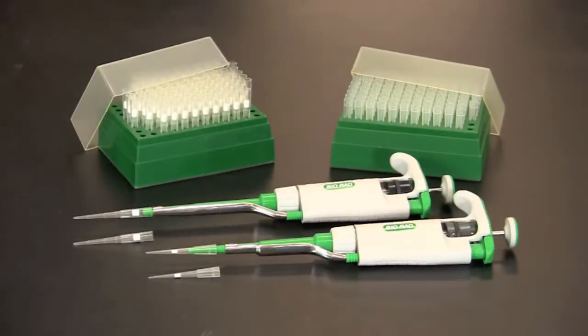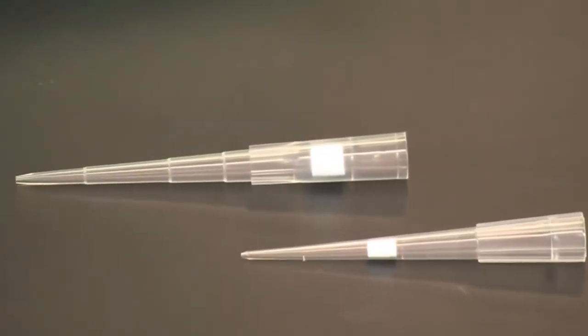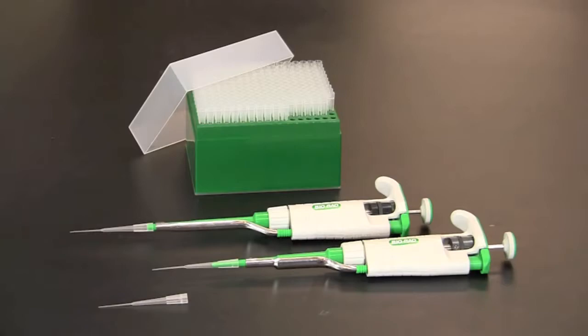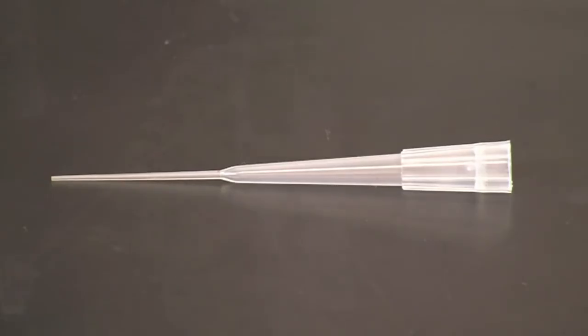Specialized tips are made for a variety of purposes such as aerosol barrier tips with a sterile filter to prevent contamination, and protein gel loading pipette tips that are designed with a narrow tip to slide easily between mini vertical acrylamide gel plates.